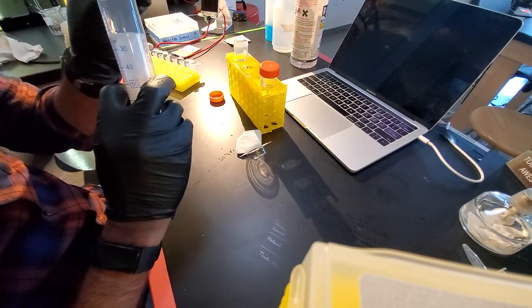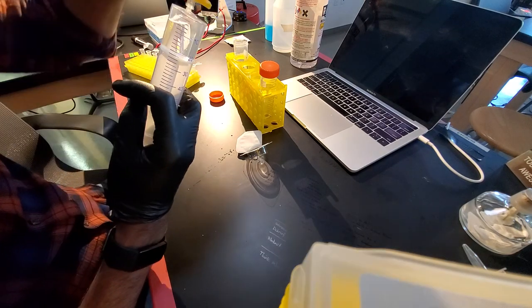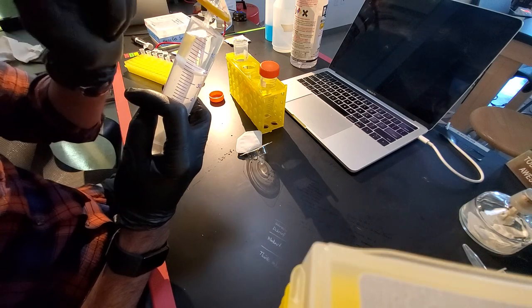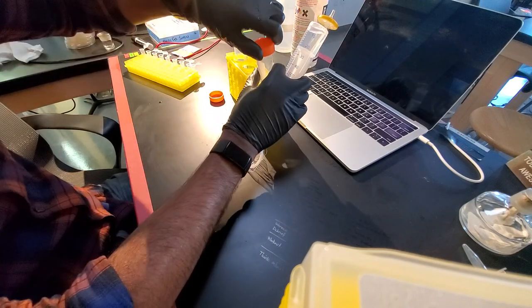So I'm going to go ahead and put my filter sterilizer on the tip here. And I'm going to avoid touching this tip. Anything kind of below the filter, I can touch. Anything above the filter is going to be sterile, so I'm going to really want to be careful with.